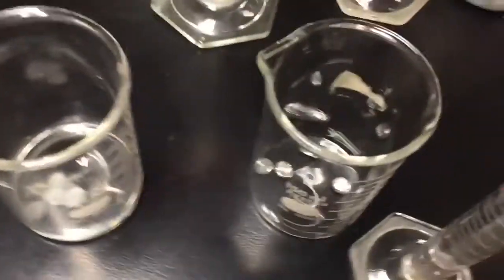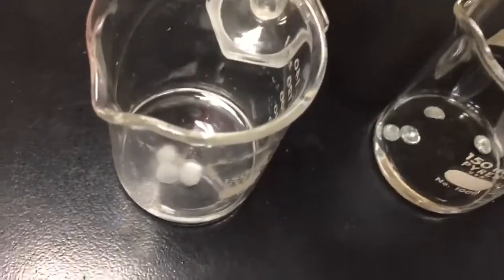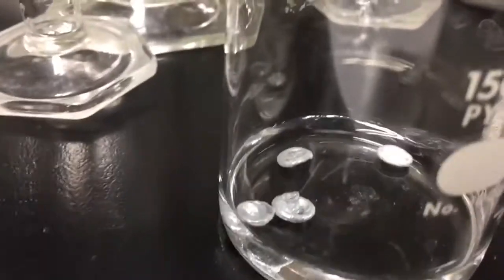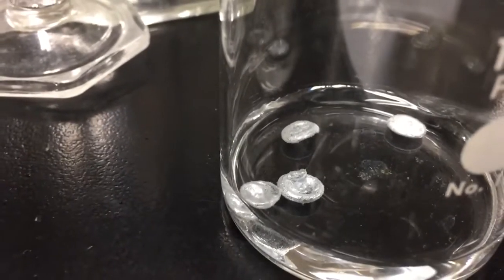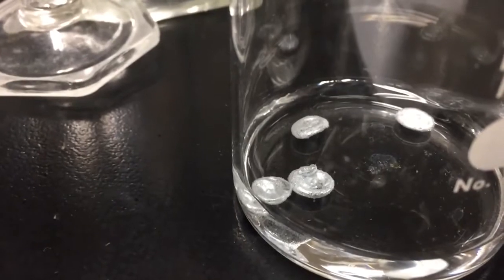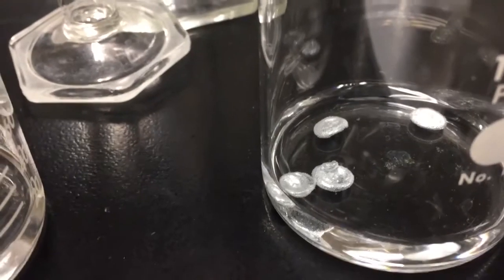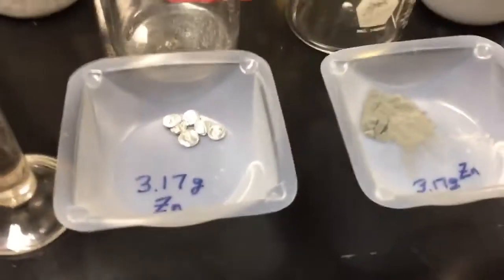And we'll add that to the zinc ingots. And we'll see how fast this reacts. So once again, here's the 6 molar reacting with the zinc ingots, and here is the 10-fold dilution. So this is 0.6 molar, and I imagine there's some reaction going on, but it's very, very slow. So the higher the concentration, the greater chance there will be for meaningful collisions between particles, and therefore the rate will increase.